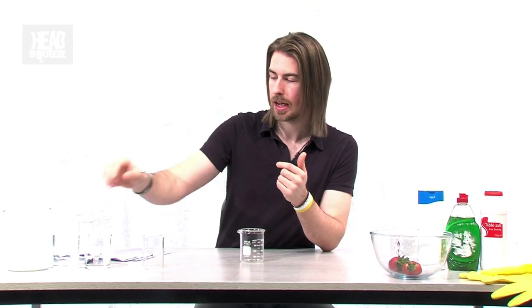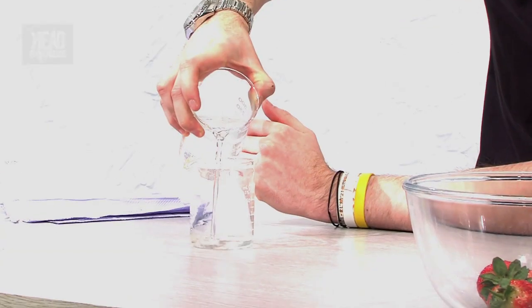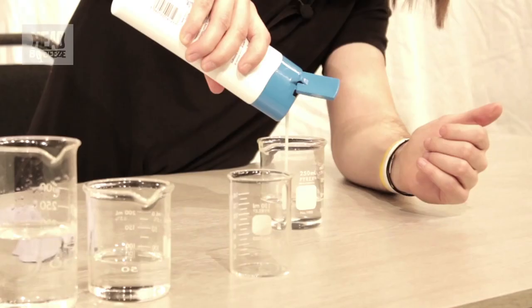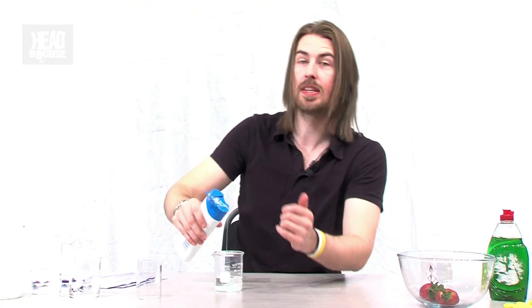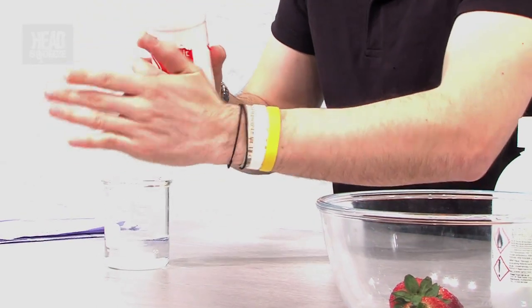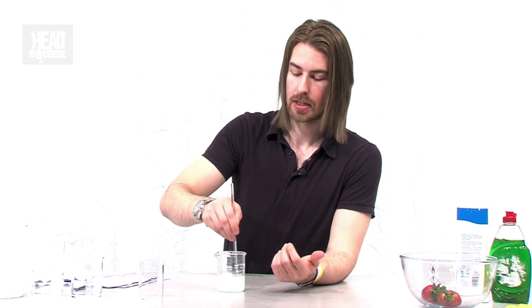For this we're going to use about 90 millilitres of water, a little bit of shampoo, and some table salt. The shampoo and salt will break down the cell walls and make it a little bit easier for those cells to let the DNA out — that's what we really want, the DNA to come out from the cells and into our extraction solution. Then mix it up gently for a couple of minutes so there are no bubbles.